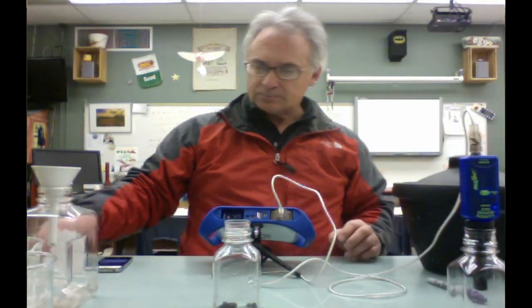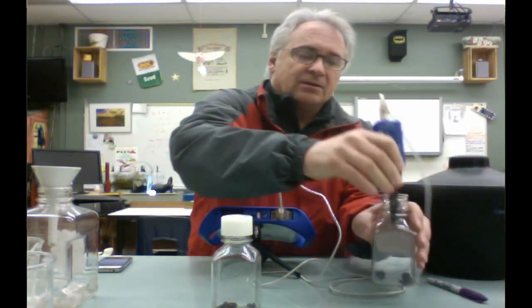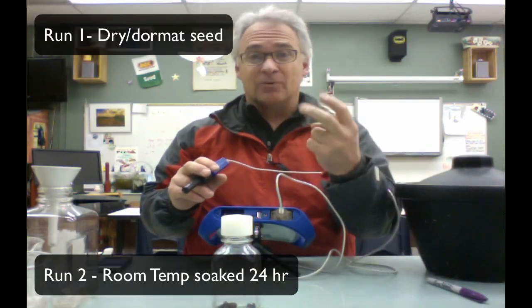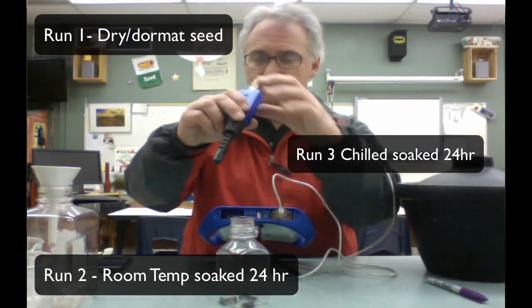All right, those are nice and cold. And cap that off so it doesn't get too acclimated to the surroundings. Now let's say the 10 minutes is up, so I stop it. Now I have basically 2 runs. The first run was with dry, dormant seed. The second run was with the seed that has been soaking in room temperature. And the last run is going to be the colder temperature.